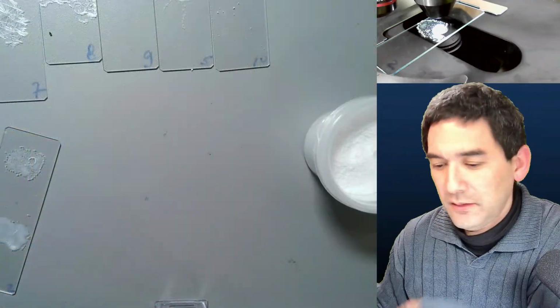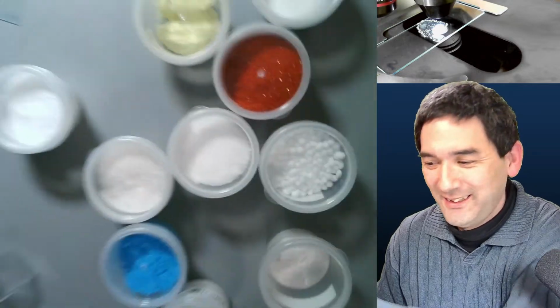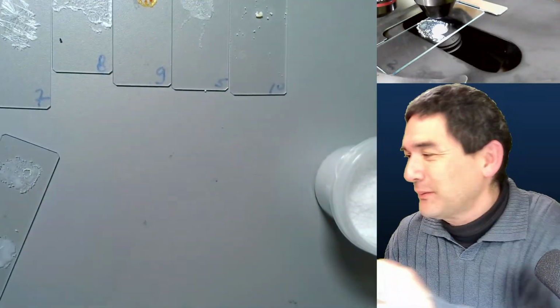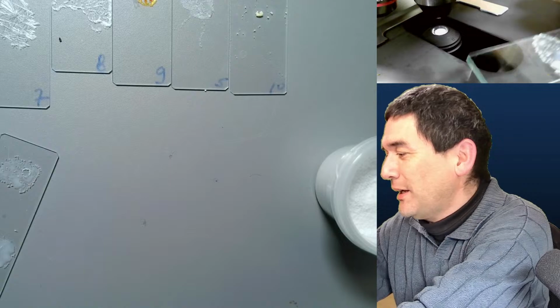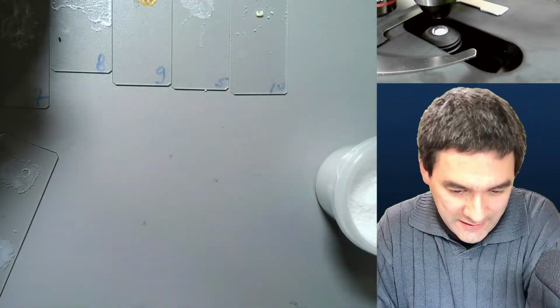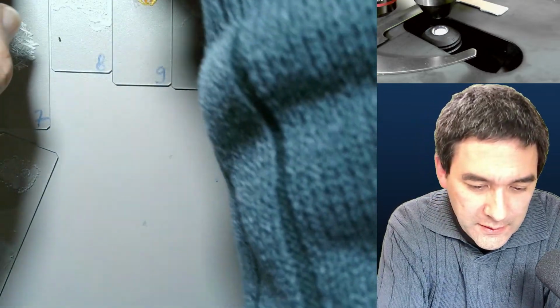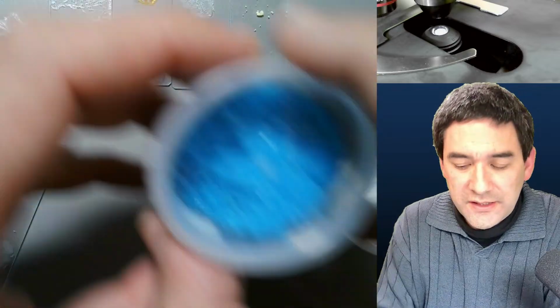The desk here. Yeah, look. There's still so many substances that I have. And what's another one here? So let's put this away. The number 3 is copper sulfate. Ah, that's an interesting one. This one has also given me a little bit of a headache. The copper sulfate. And the copper sulfate looks like this.